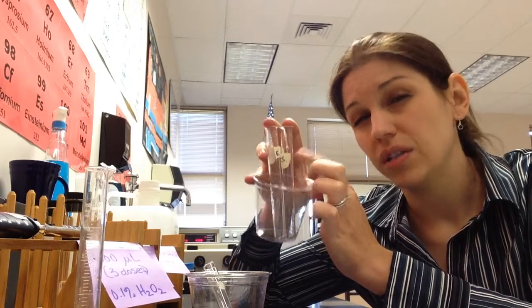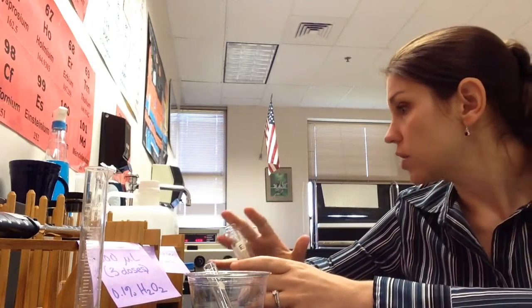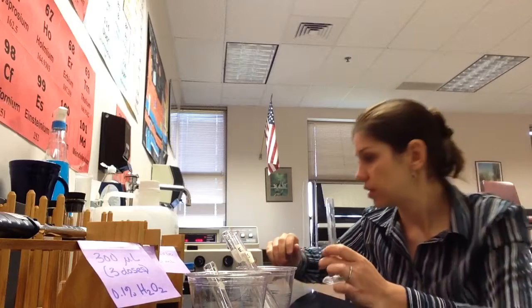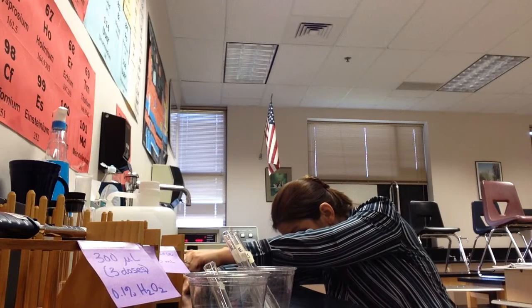What's important is that you use DI water for this. Don't use tap water. It will mess with your results, and so we want to make sure that we use our jug. So to measure our water, you're just going to use your graduated cylinder. And so I'm going to start by filling my substrate test tube with 7 mils. And you do need to be fairly precise with this.